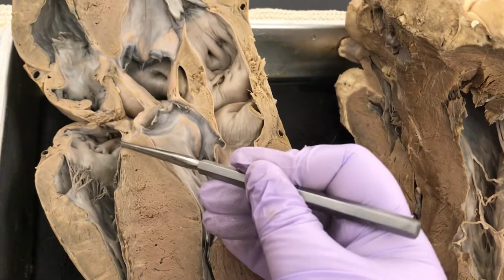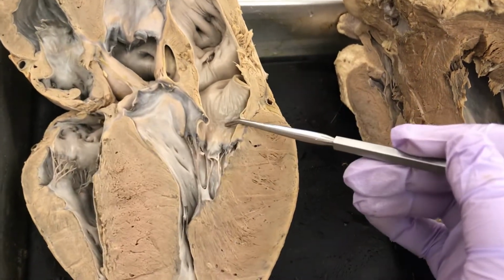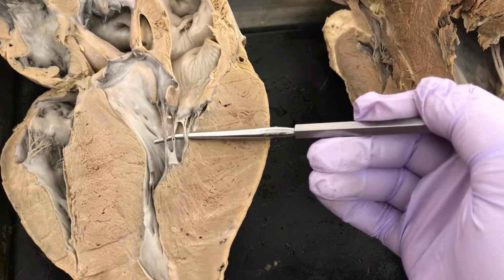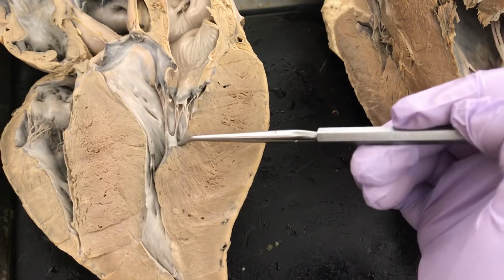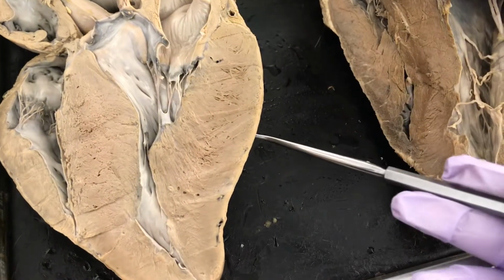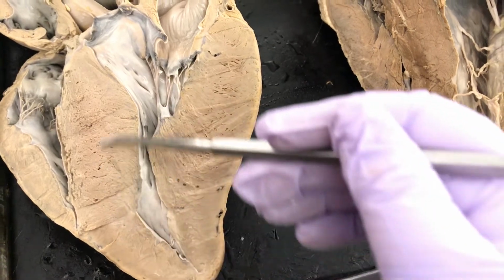All right, so the valves themselves, we know that it's right to tri, so this is the tricuspid on the right side. Over here we have the bicuspid. Both the bicuspid and tricuspid are held down by the chorda tendineae, these heartstrings. And the chorda tendineae attach to these muscles, the papillary muscles. Now the smooth layer inside here is called the endocardium. Remember, we had epi on the outside, endo on the inside. All of this muscle is the myocardium.